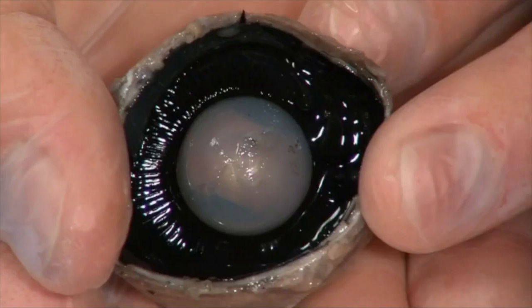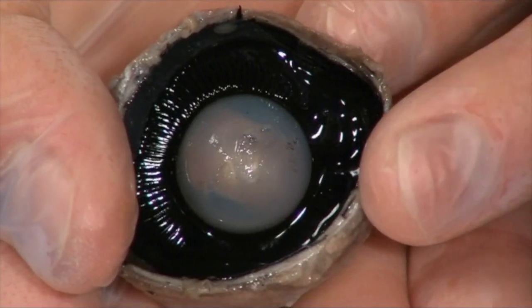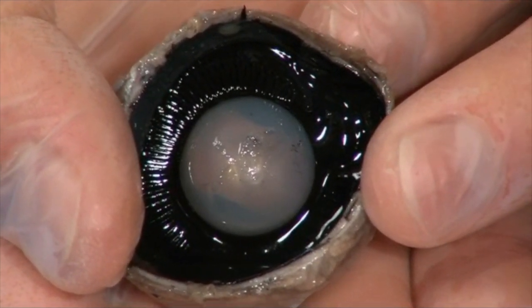In life, the lens is a much more flexible structure, and the muscles can pull and change the shape, which allows your eye to accommodate for near and far kinds of things, or movement and things in the light, and change the focus.